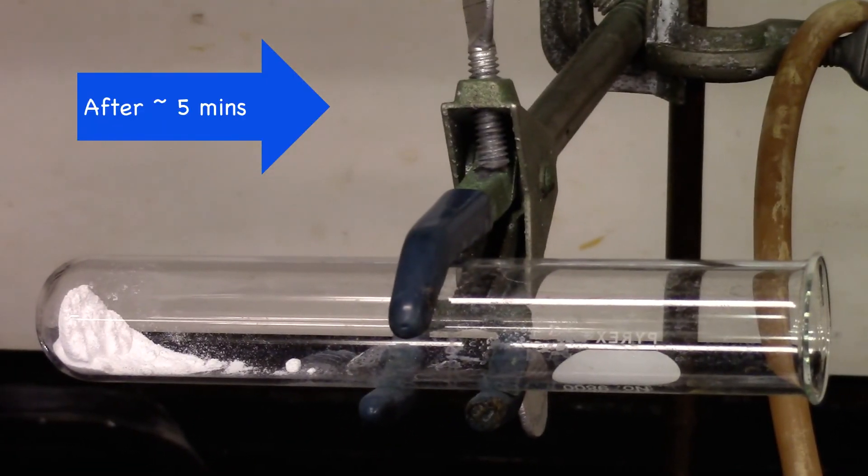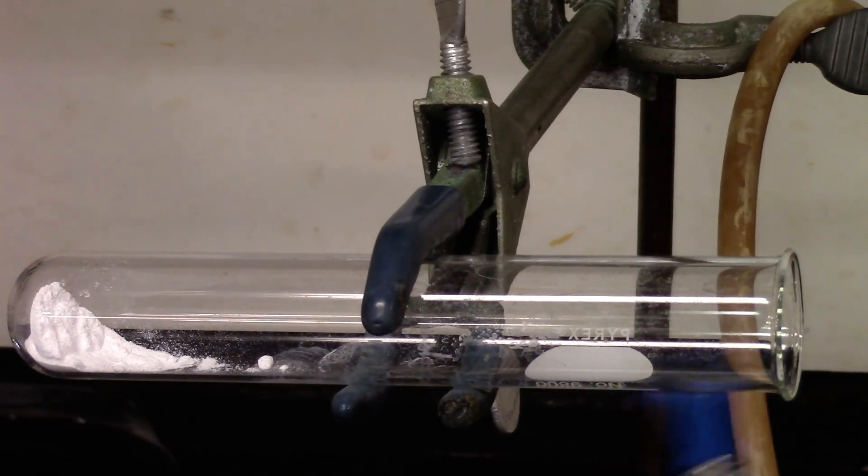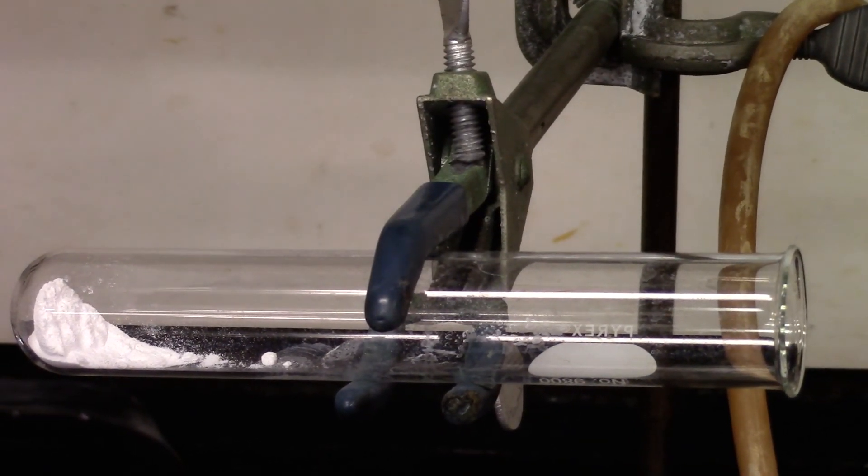Right now the test tube looks dry. All the moisture has been evaporated. I will let it cool down before I can weigh it.